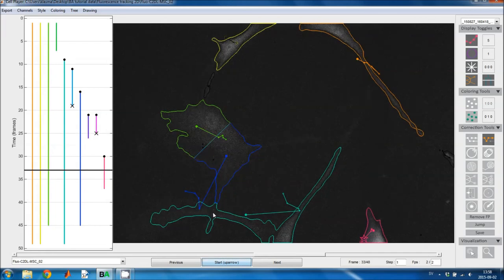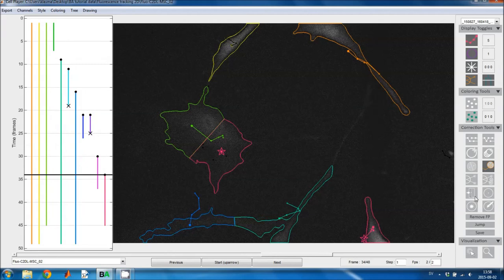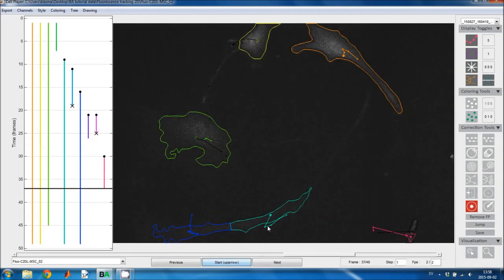Here this blue cell should have been here and not there, so I'll move that one as well. It should actually have been assigned to this cluster instead of that cluster, so I use the track split tool to move it to there, and then I'll delete this track in the future frames. And now this cyan colored cell moved out of the image, but it's still here, so I'll use the delete tool to correct the tracking mistake.